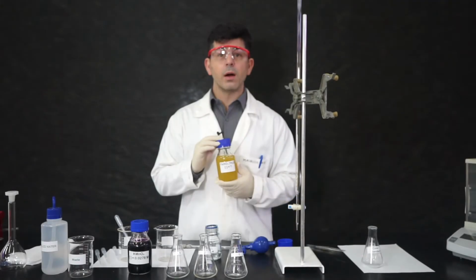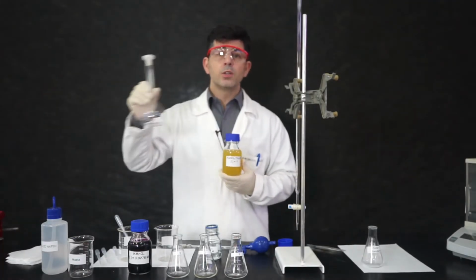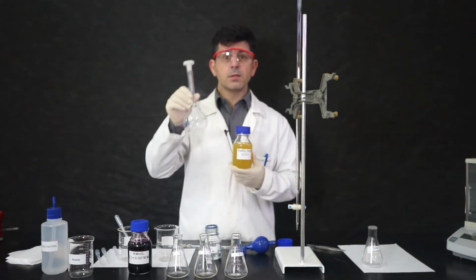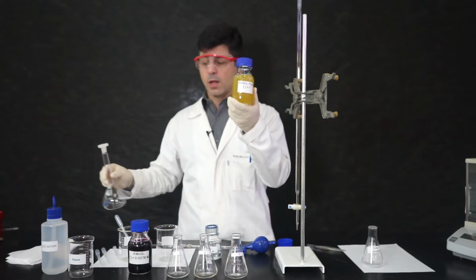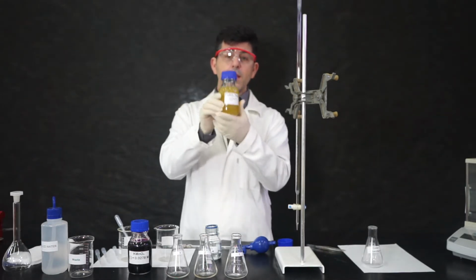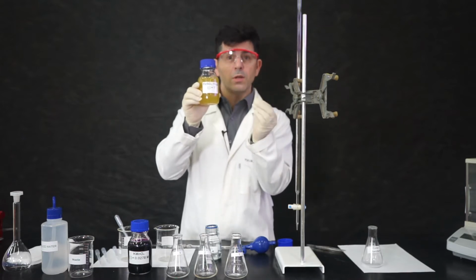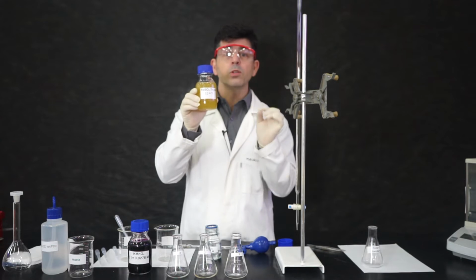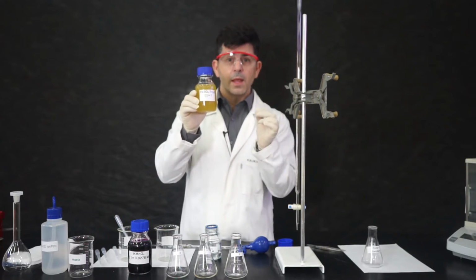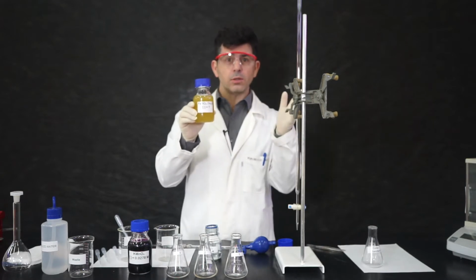So we dissolved that ore in sulfuric acid. We transferred it to a 250 milliliter volumetric flask, and then the solution is now in this flask. So all the iron that was in that piece of ore is in here now and has a certain concentration. Remember, we're talking about 250 milliliters of solution. We will analyze this solution here through the titration.